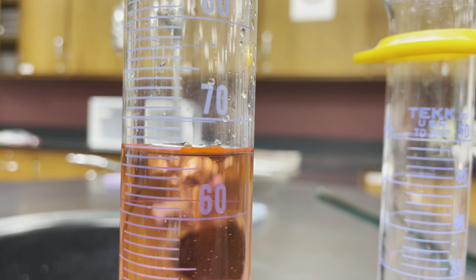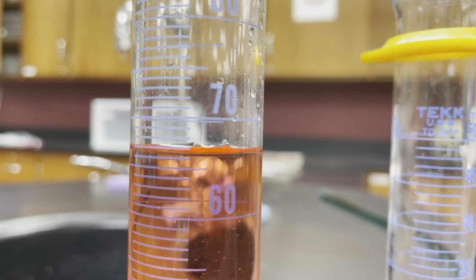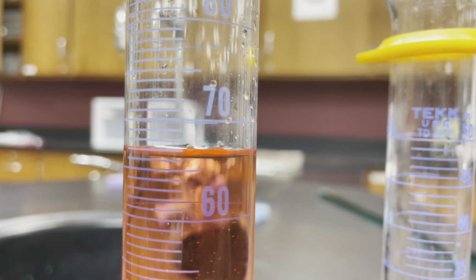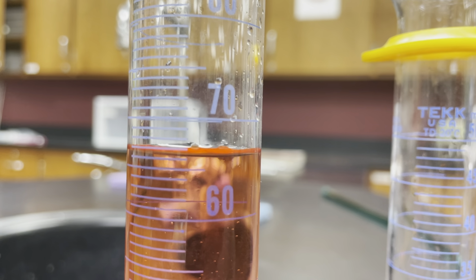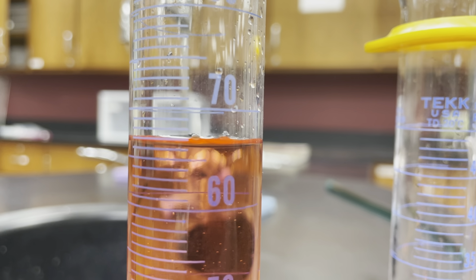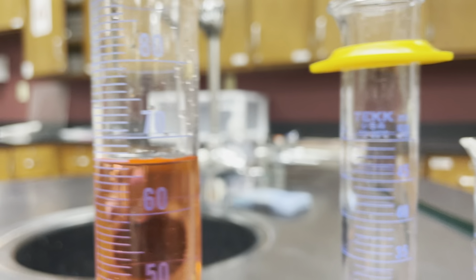So in this case, I know the one spot for certain. I have 66 plus some, or a little less than 67 milliliters, so I could say maybe 66.5 milliliters, or 66.3, or 66.7 milliliters, where that tenths place, the 0.3 or the 0.7 or the 0.5, is going to be my uncertain digit. Okay, so I could go out a little bit farther on this measurement than I would in the case of the beaker. Let's look at another example with another graduated cylinder.